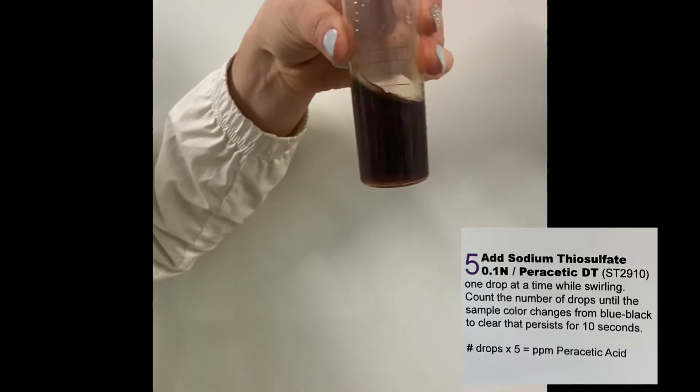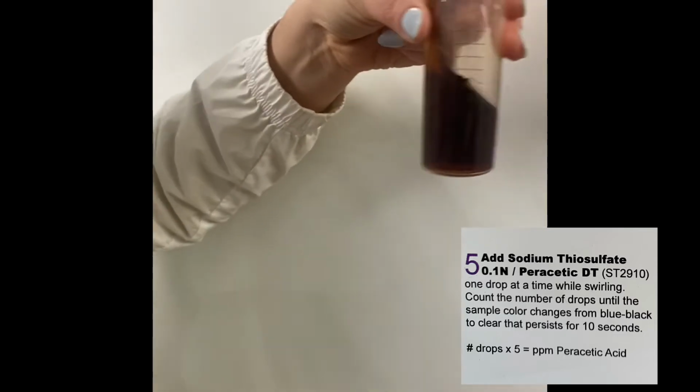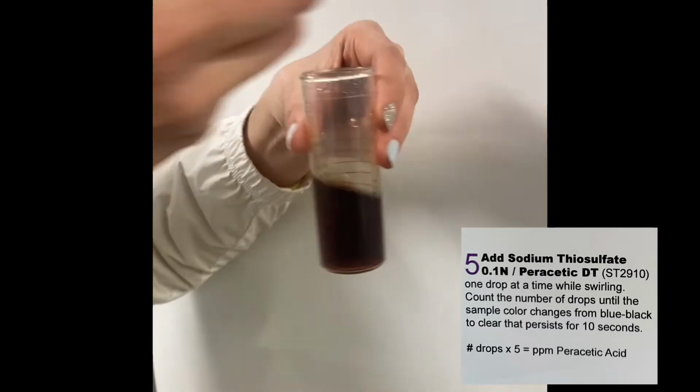The number of drops that you put in, you'll multiply by 5, and that will equal the parts per million of peracetic acid.